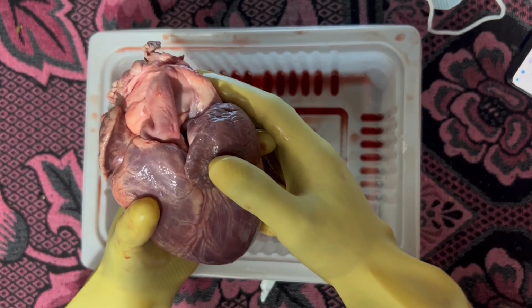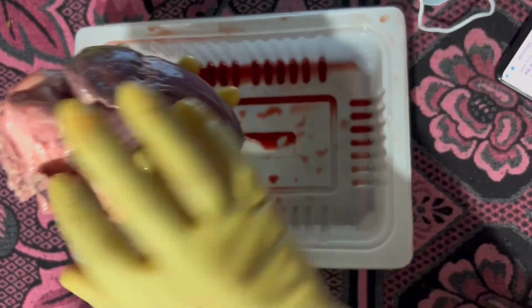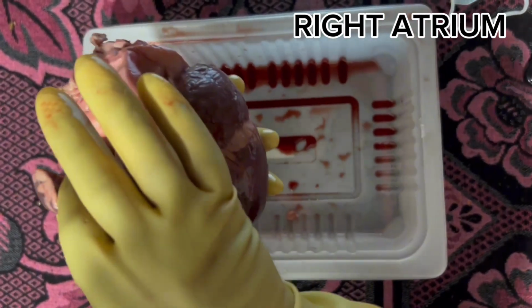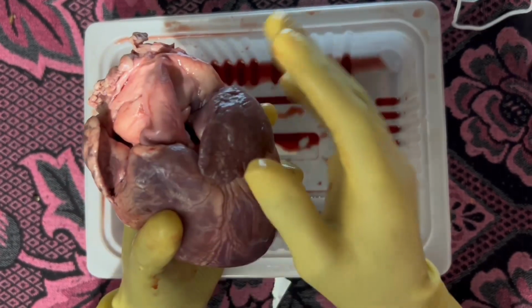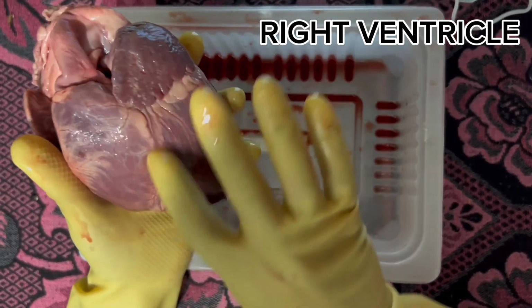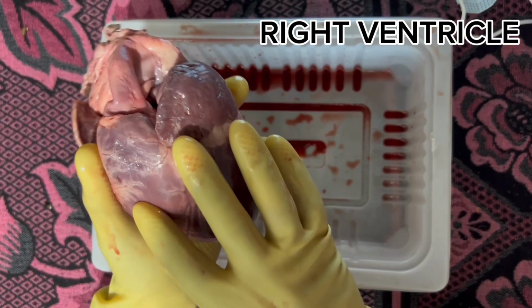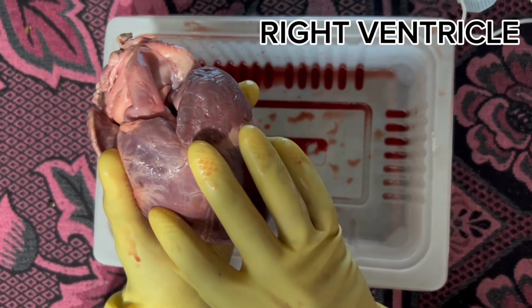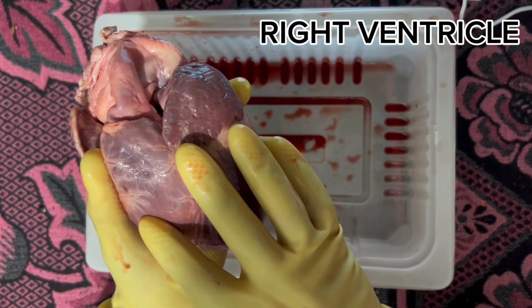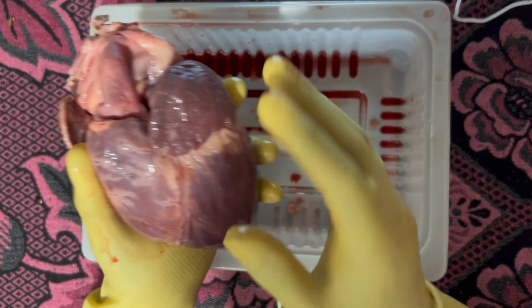Moving on to the four chambers in which blood flows. Blood enters the right atrium. This is the right atrium, which is located at the cranial heart base and passes through the right ventricle. This is the right ventricle, which is located immediately behind the sternum. The right ventricle pumps the blood to the lungs where it becomes oxygenated. The oxygenated blood is brought back to the heart by the pulmonary veins, which enter the left atrium.